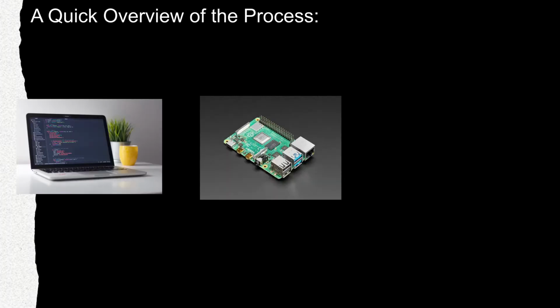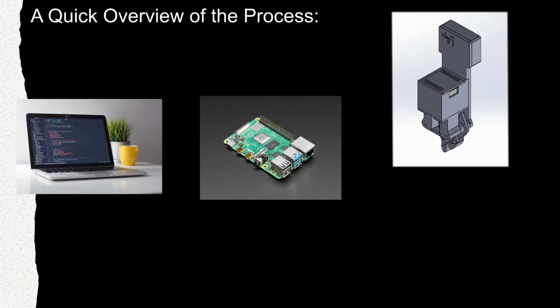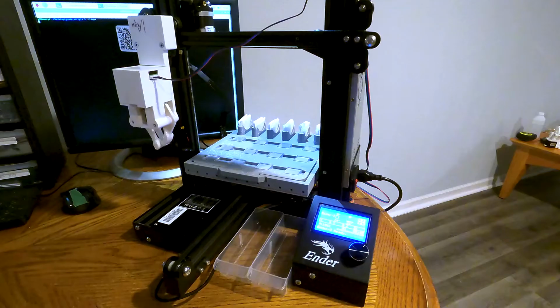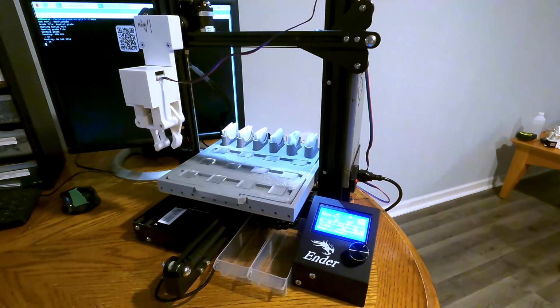A quick overview of the process. This entire process is run by a code written in Python that interfaces with a Raspberry Pi. The Raspberry Pi then talks with the motor that is controlling the gripper and also talks to the processor of the 3D printer that is controlling the 3 stepper motors in the XYZ planes. Now, let's see it all come together.